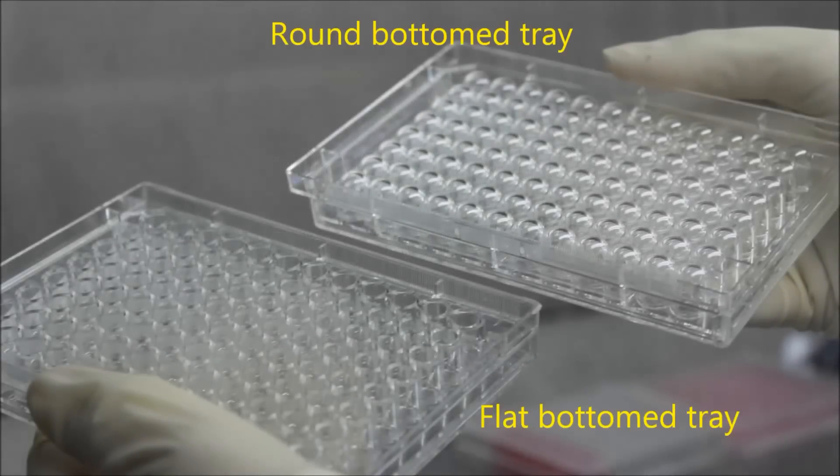Firstly, make sure you note the difference between a flat bottom and round bottom tray before you begin. You will be using the round bottom tray for your dilutions.